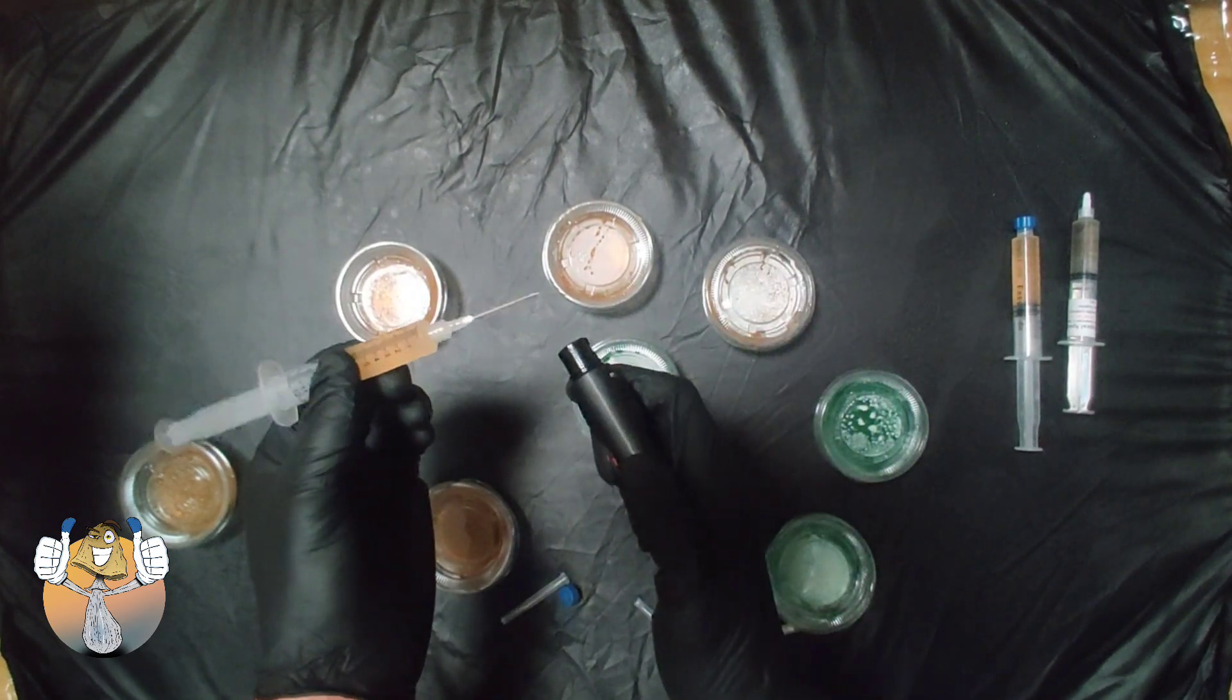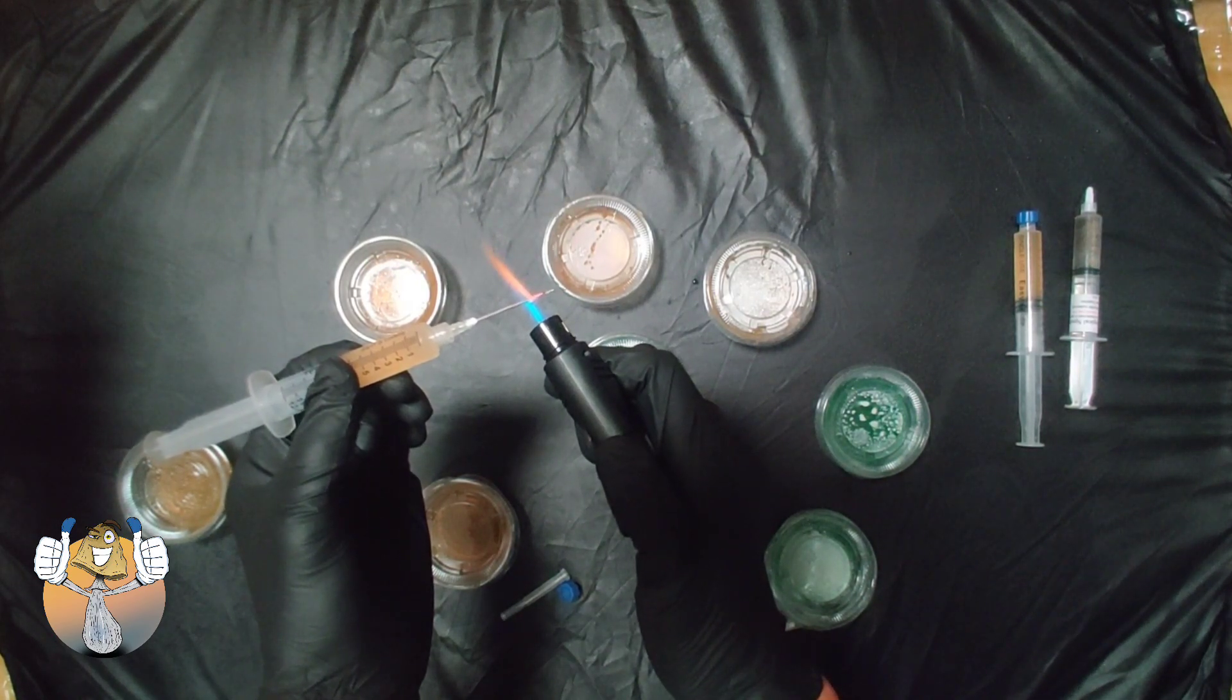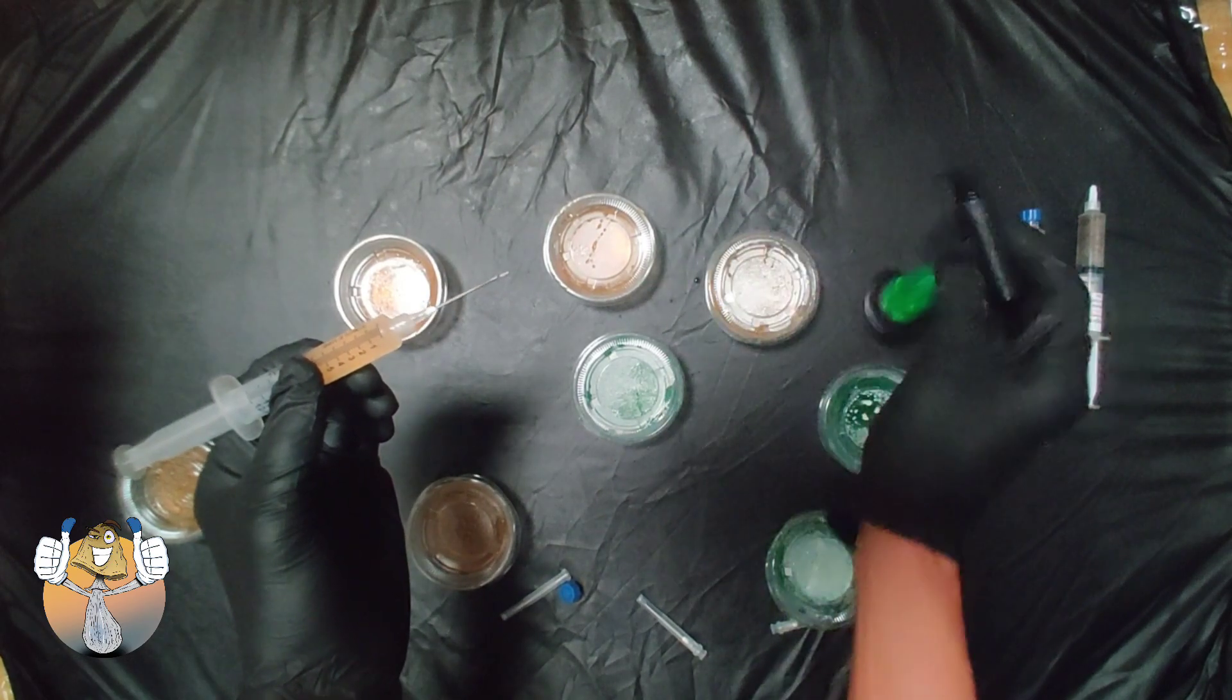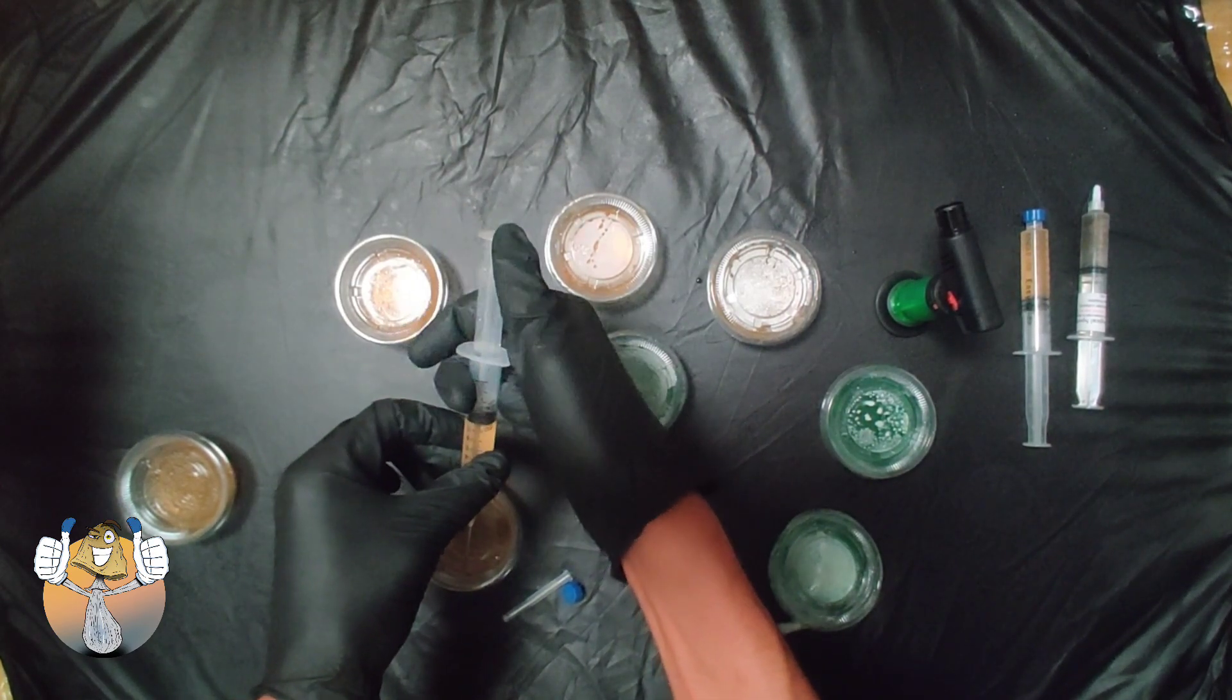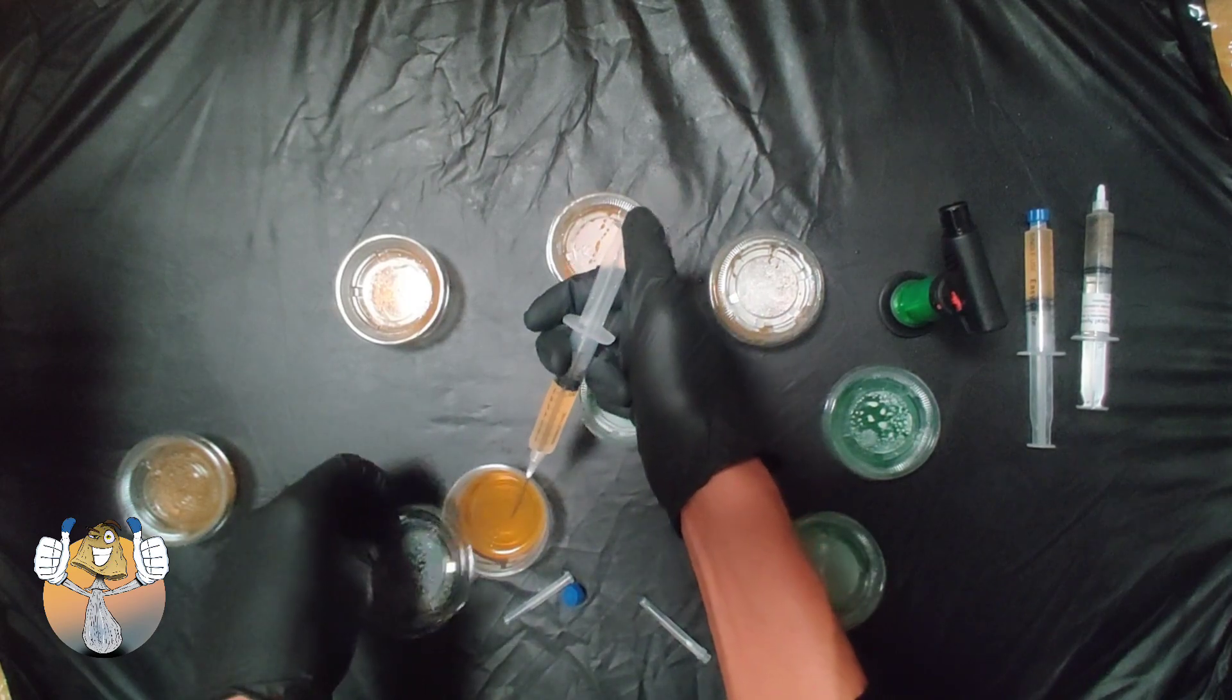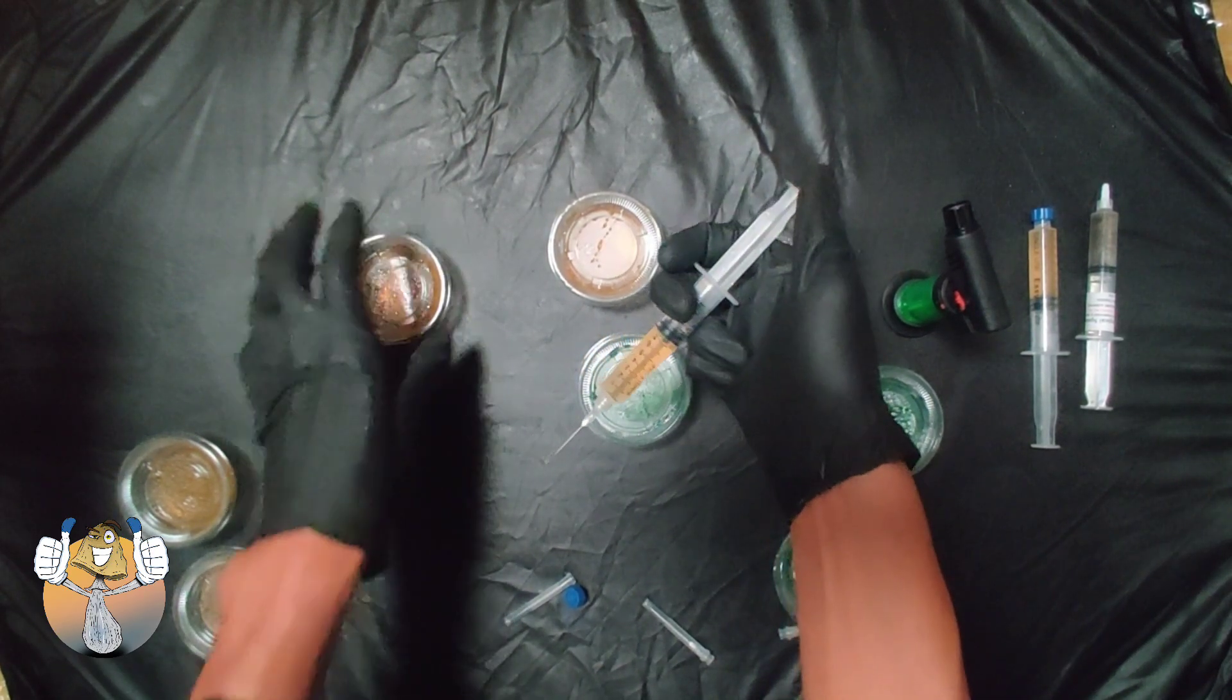Each one, flame sterilize. So the reason I'm not too worried about the flame and having the alcohol, because I let the still air box sit for a half an hour. I figured I would have time for the fumes to evaporate some. Trust me, I was being cautious. I definitely didn't want that thing to explode in my face or blow up the damn kitchen. So we took caution. So just a little drop, close it back up, slide it over and start on the next.